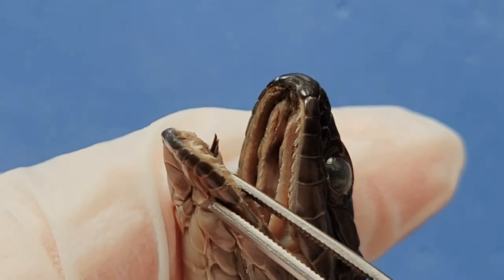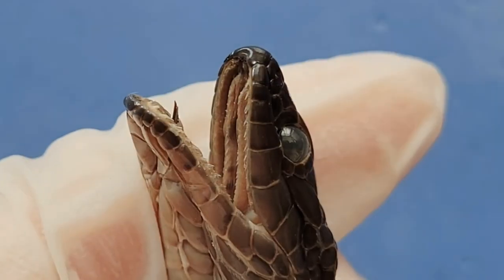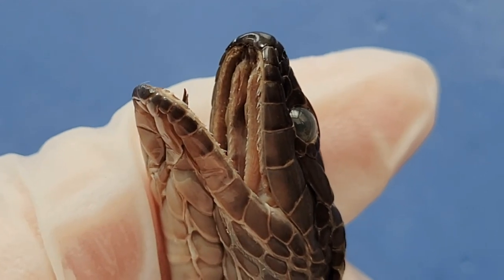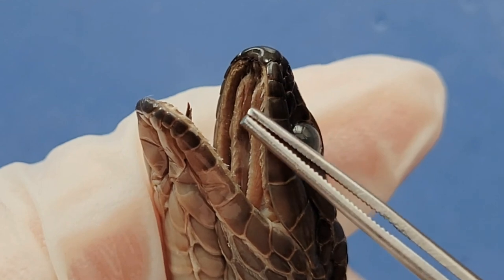This is just a little segment of the tongue that you can see peeking out right here. You can also see the teeth a little better here, and as mentioned before, the teeth of the snake hook backwards.